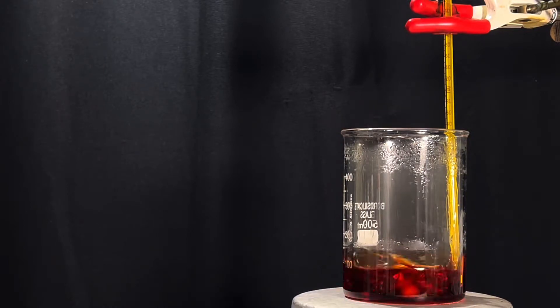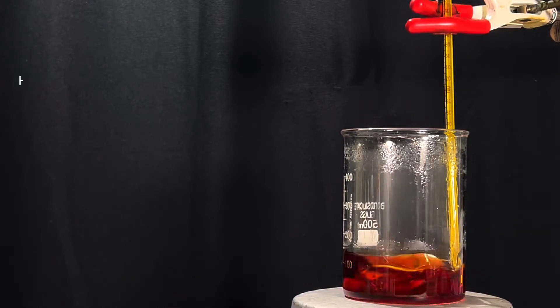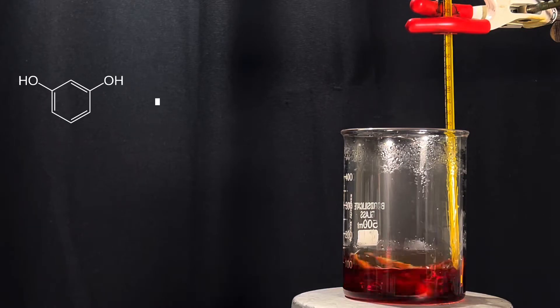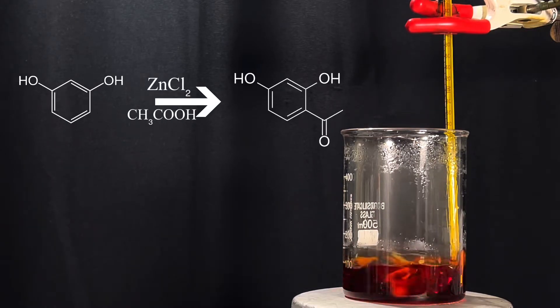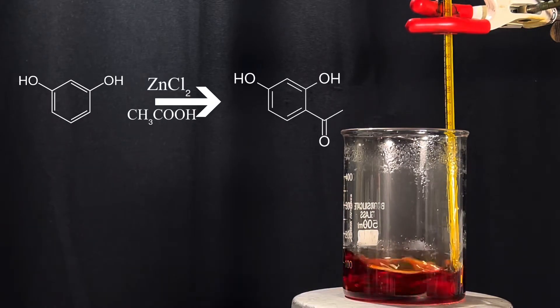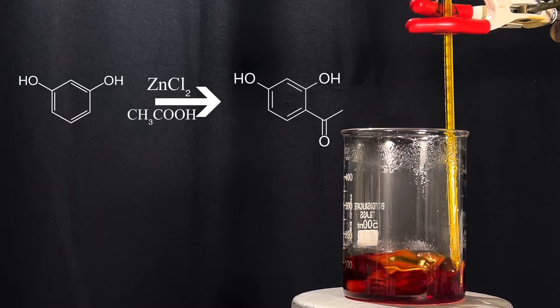The reaction occurring here is shown on screen. Resorcinol in the presence of anhydrous zinc chloride and glacial acetic acid forms 2,4-dihydroxyacetophenone.